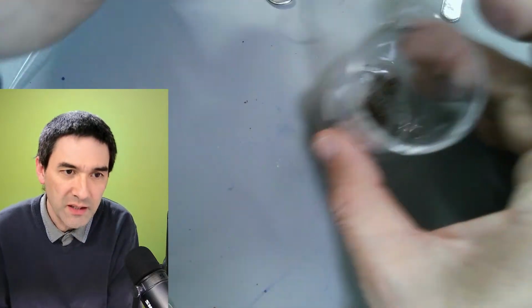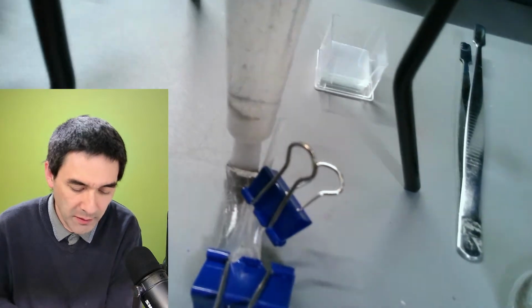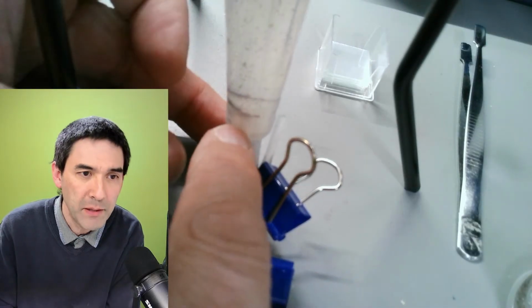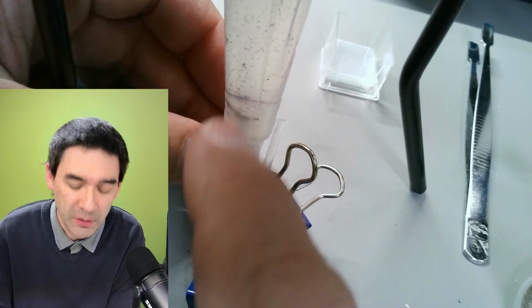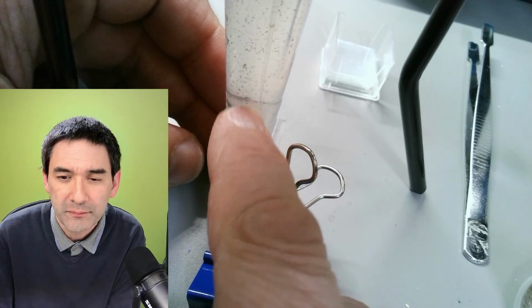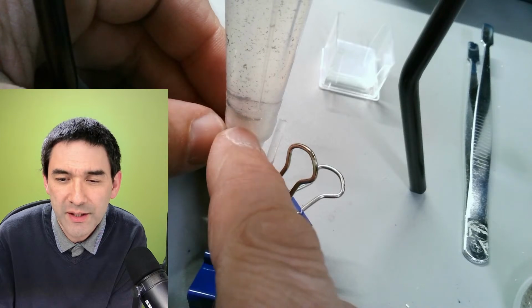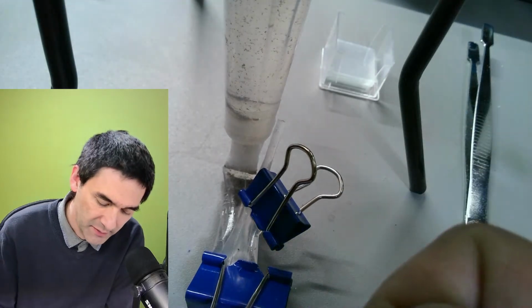And I used this parafilm also over here to connect the pipette. I cut this one off, and I inserted it, and I basically wrapped the parafilm around here to give it an airtight, especially a watertight connection. You can already see that there's still some more of these particles floating down here. I buy it cheap in bulk on AliExpress. So in any case, this is what I've been improvising a little bit.